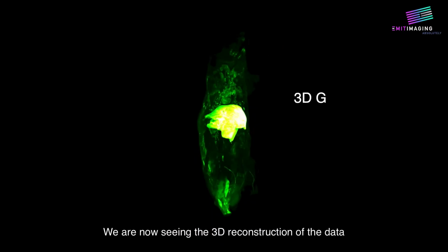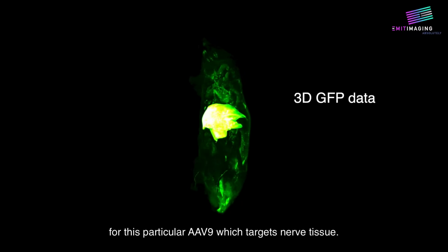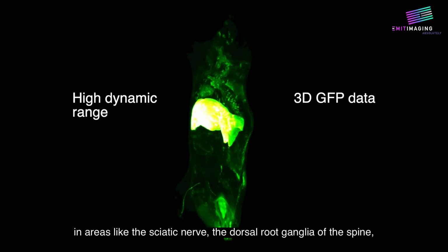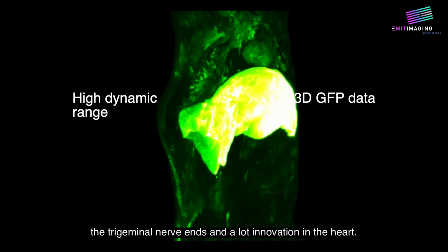We are now seeing the 3D reconstruction of the data for this particular AAV9, which targets nerve tissue. We are seeing the majority of the signal in the peripheral nervous system in areas like the sciatic nerve, the dorsal root ganglia of the spine, the trigeminal nerve ends, and a lot of the innervation of the heart.